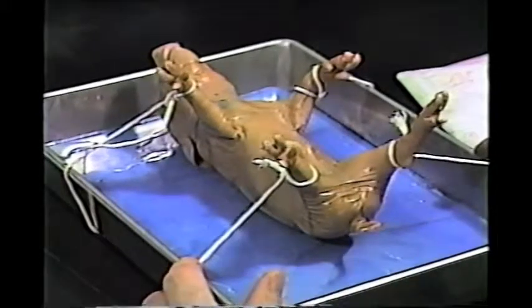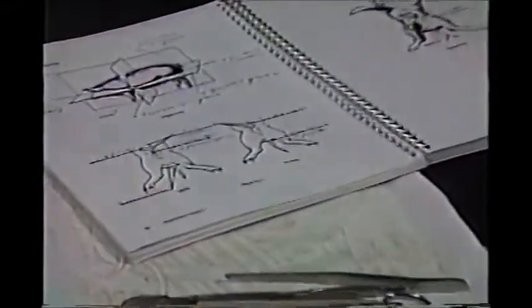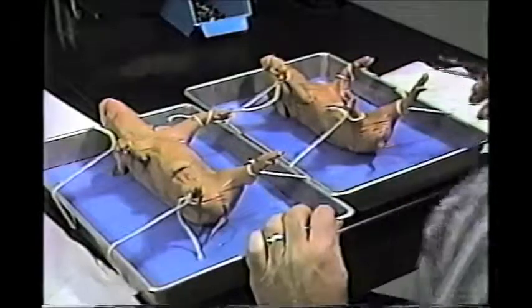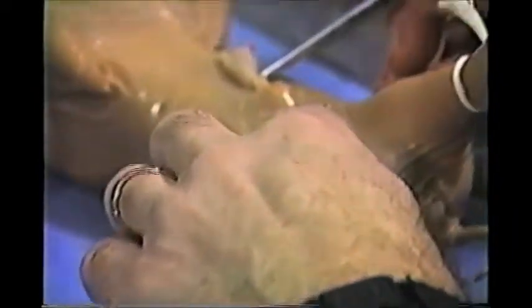This is a male pig, and in figure 6.7 in your lab book, they show you the difference. What I'm going to do is just bring in the female pig and take a look at the two together. With both pigs, you can't use the row of nipples or teats because both the female here on my left and the male here on the right have 2 rows of nipples.